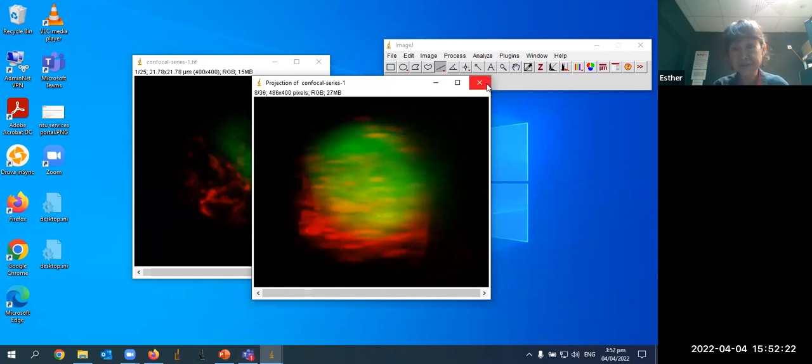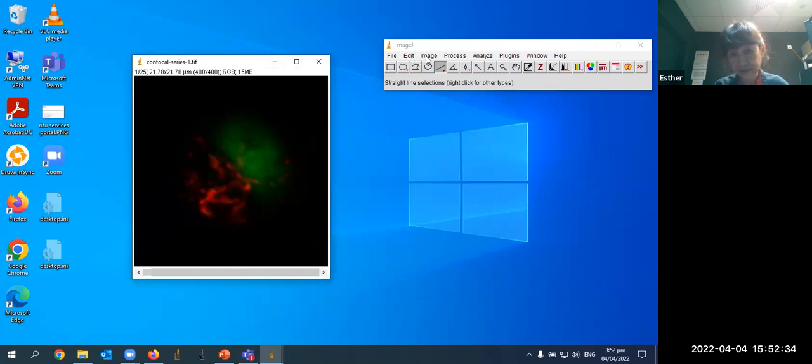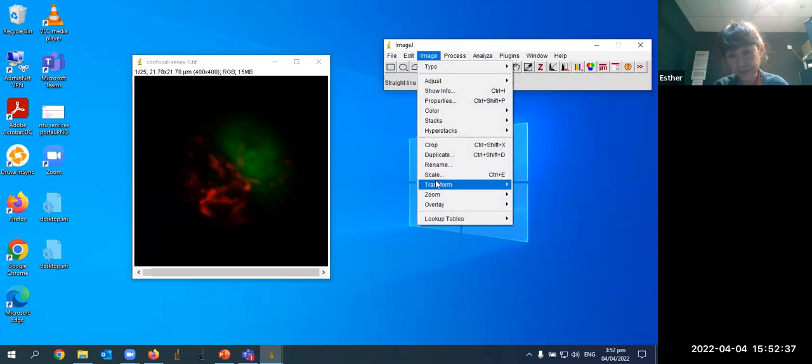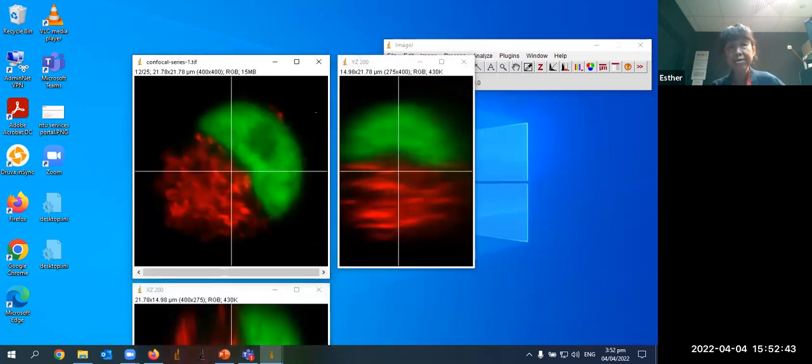The other thing you can do, of course, is you can look at the orthogonal views. Some people have some difficulty visualizing a 3D stack with orthogonal views, but I find it quite useful to show. So I'm just going to quickly show you how you can get orthogonal views from a 3D stack. So the original image on the top left corner, this is the XY view. You're looking at the lateral image XY, like looking from the top of the sample. And on the right hand side, we have the YZ view. So you're looking sideways at the image, and where the crosshair is, this one here.